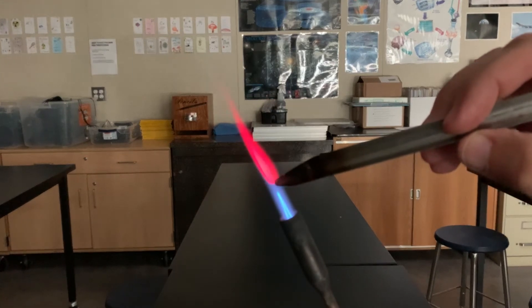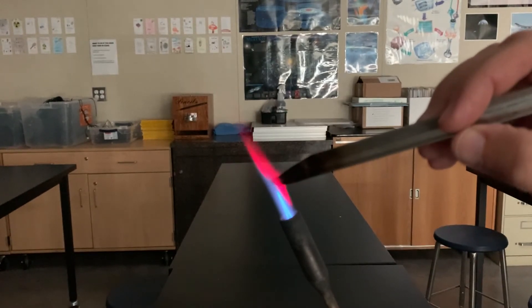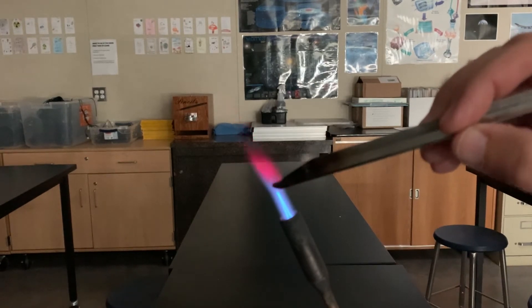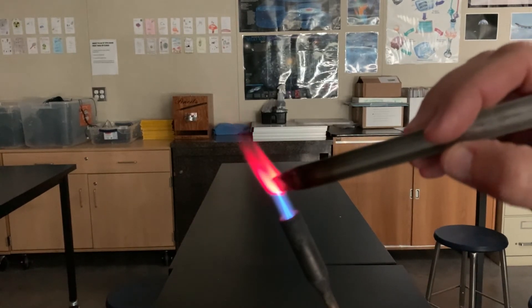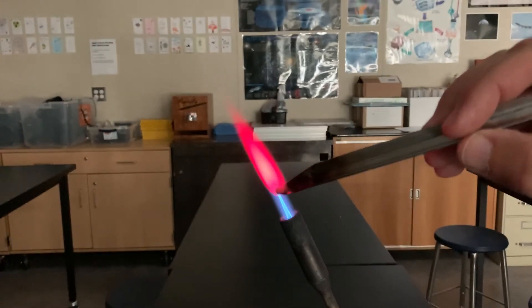Lithium chloride produces a beautiful red color. Right there.